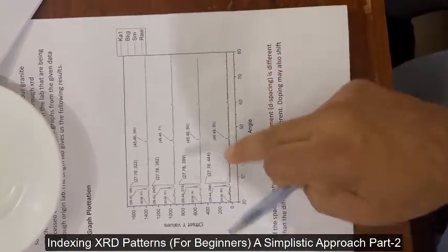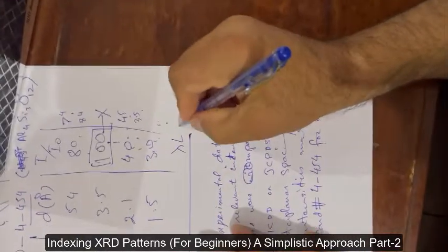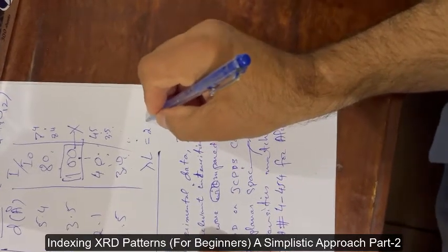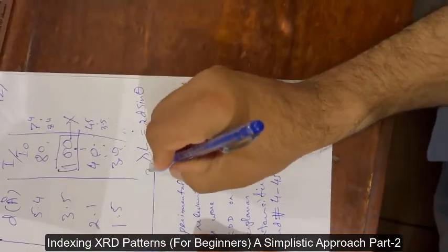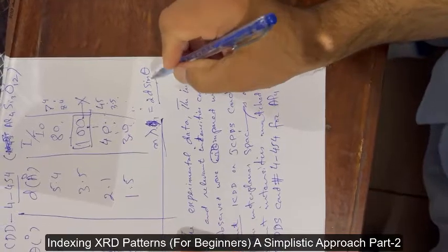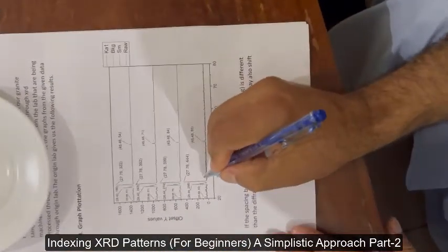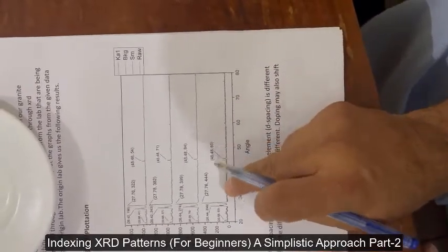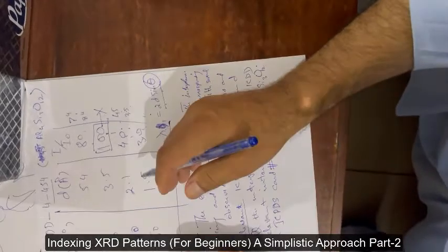There is no intensity at certain positions because the diffraction condition is not met. In XRD, n·λ = 2d·sinθ. Wherever that condition of theta is satisfied, it gives you a Bragg reflection at a particular angle. Where that condition is not satisfied, destructive interference occurs and there will be no peak.